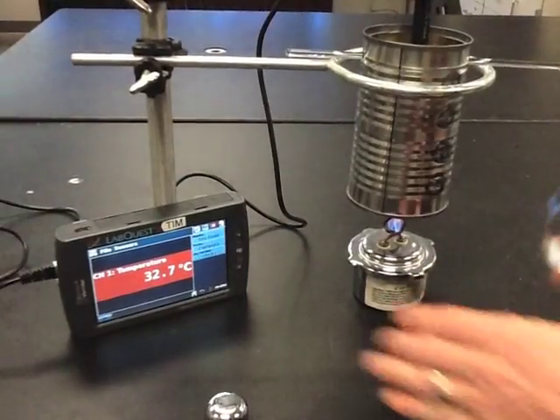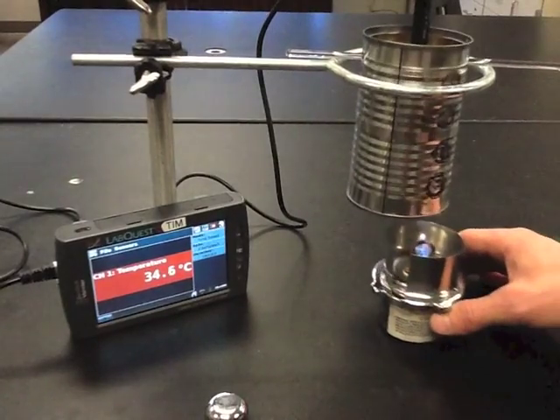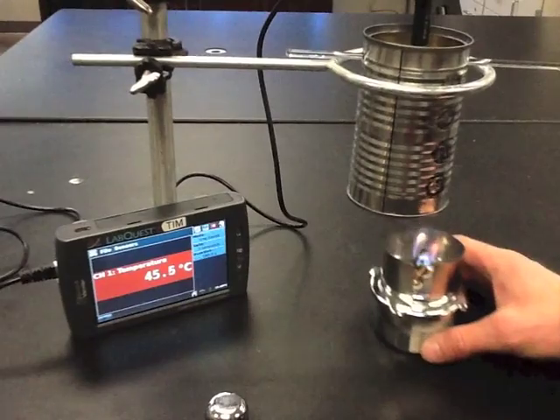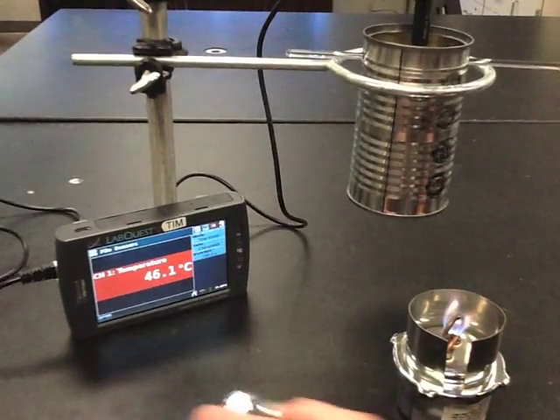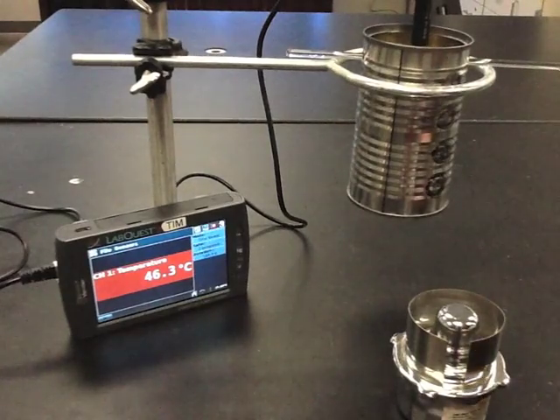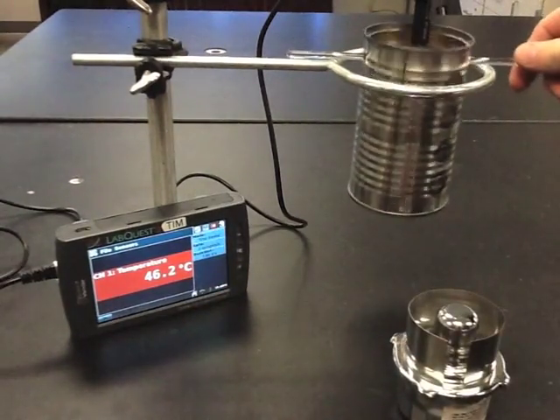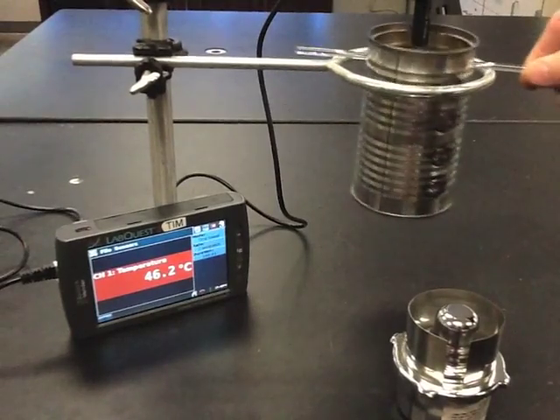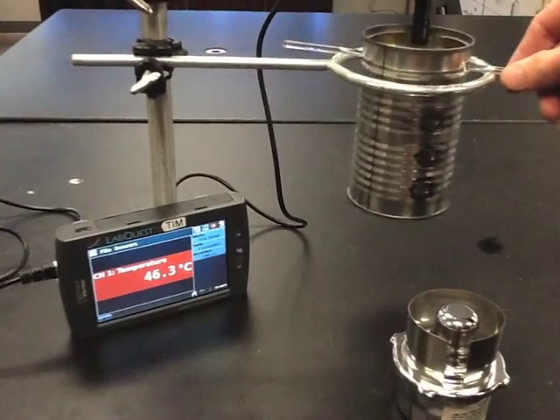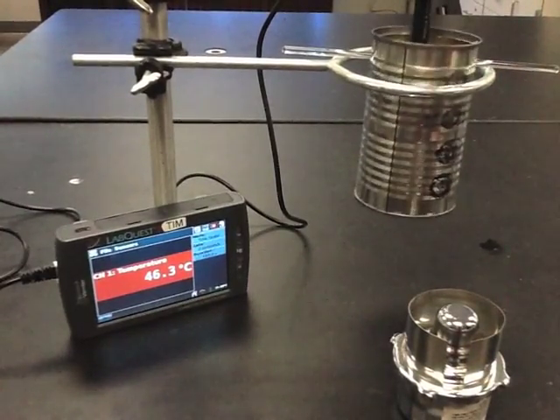If you're wondering what the heat shield is for, it's up to you — you can try to use it. My LabQuest is showing that I'm at about 45 degrees, so I'm going to take the cover and easily extinguish the flame. I'm not going to record my final number yet because it might change a little bit. Move the water around, mix it, and allow the temperature probe to settle at the right final temperature.